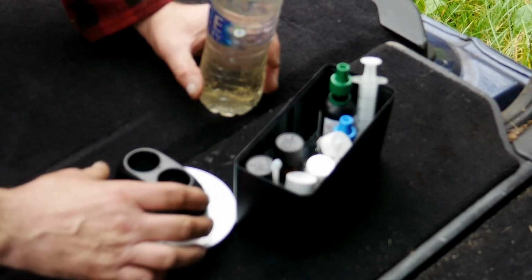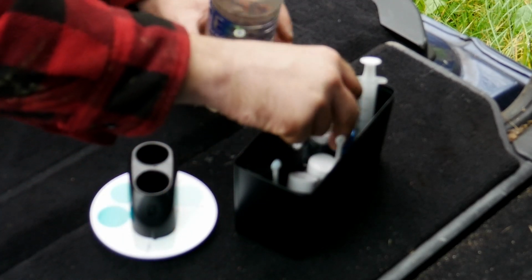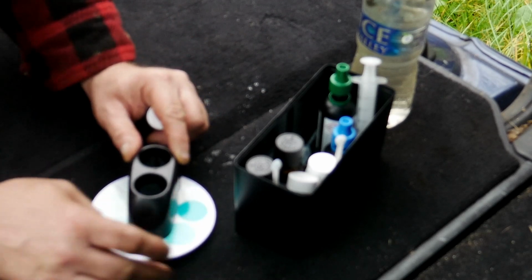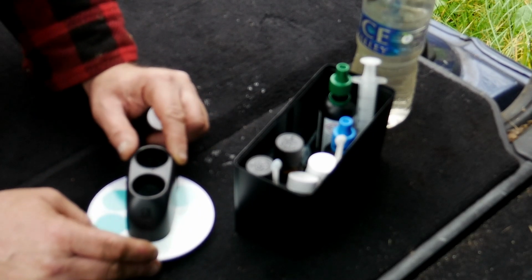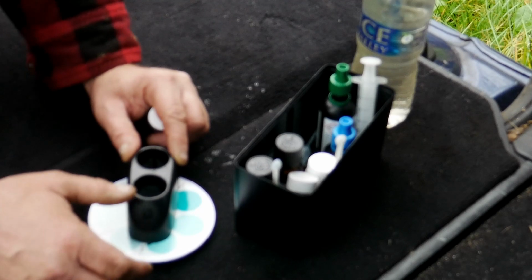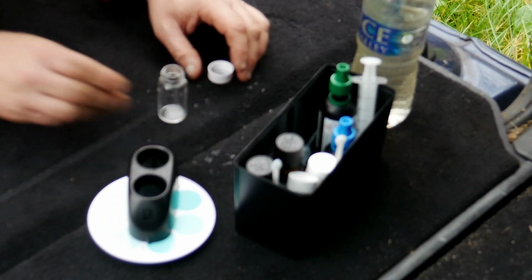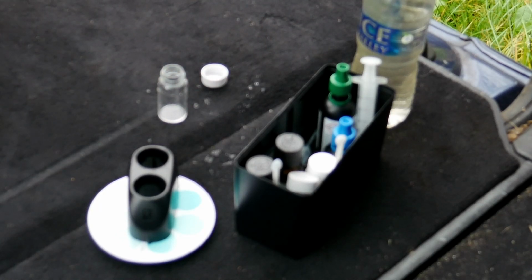To recap, I now know that the water basics are okay, but we need to find out if the water suffers from high nutrient concentrations, leading to eutrophic conditions. To investigate this, I will use another kit that accurately measures low range phosphate and nitrate. To measure phosphate, I'll start off by assembling the comparator, which has a central dial with various colours representing the levels of phosphate.